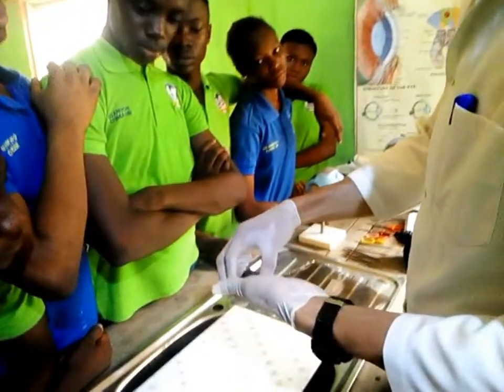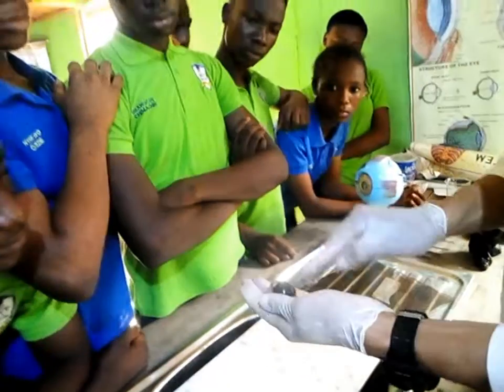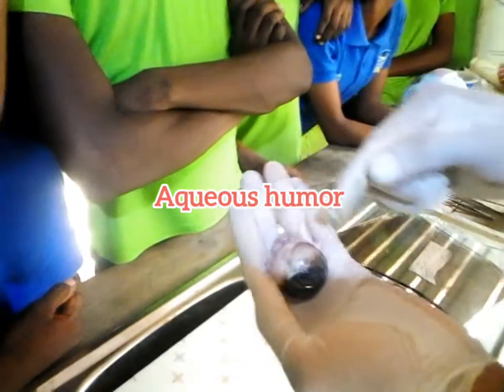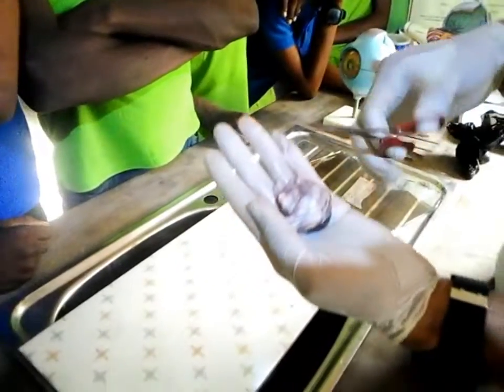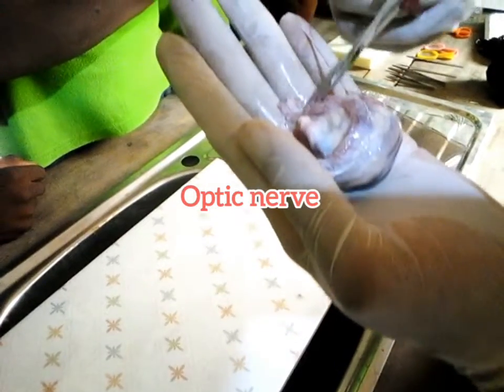Now I'm going to cut into it. Now if you look at this, you see some fluid inside. Are you getting me? The fluid in the front, like I told you, is aqueous humor, while the one that is inside is called the vitreous humor. I think I told you about it. Okay, so now we're going to cut in. Now, before we cut, we have the optic nerve. I told you before, the optic nerve.